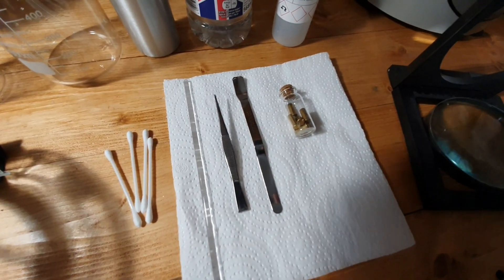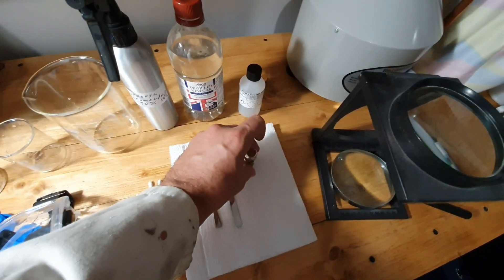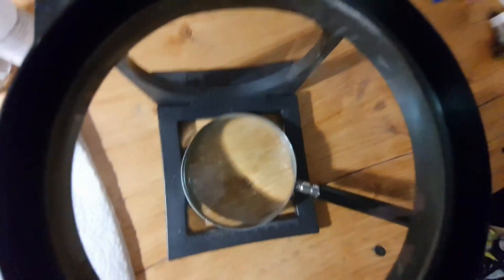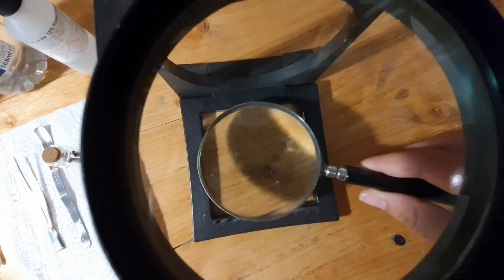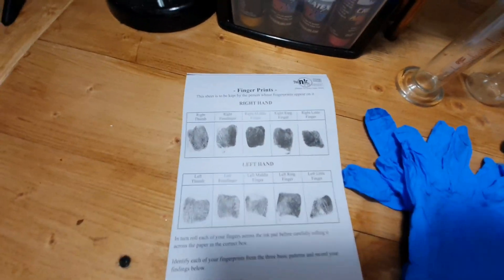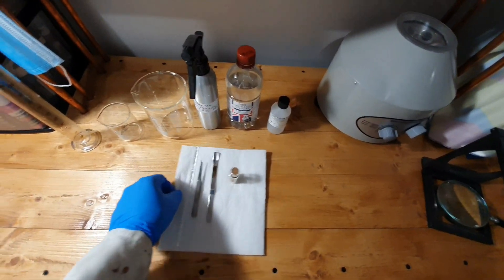I'll clean up any spills. And then obviously we have the bullet shell casings — they're extremely small, like .22 caliber. I thought they were going to be a lot larger, but they're not. We're going to need something to magnify visualization, so I have a couple of magnifiers to increase focus and magnification. And then also, just for the hell of it, I do have some samples of family members' fingerprints. Let's clear the surface — we always like a nice clean work surface.